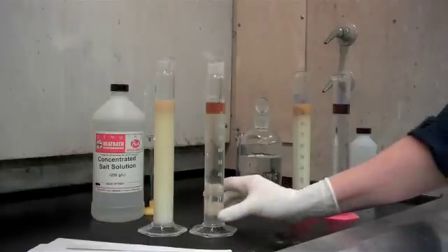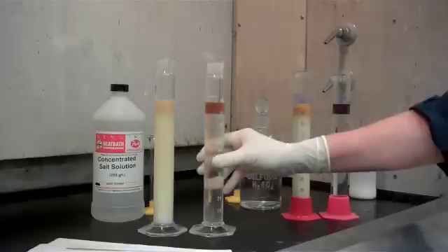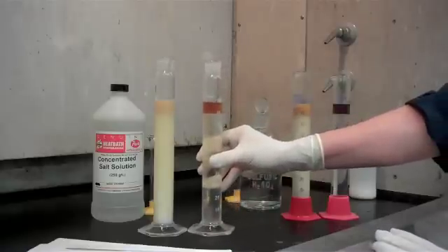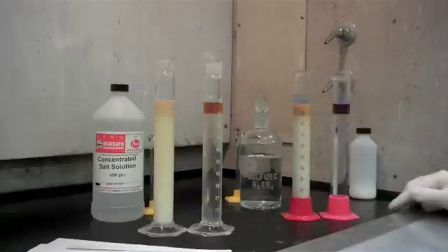If the sample doesn't split out nicely like this in a short amount of time, you can take this whole flask and put it in a bath of boiling water and the oil will split out.